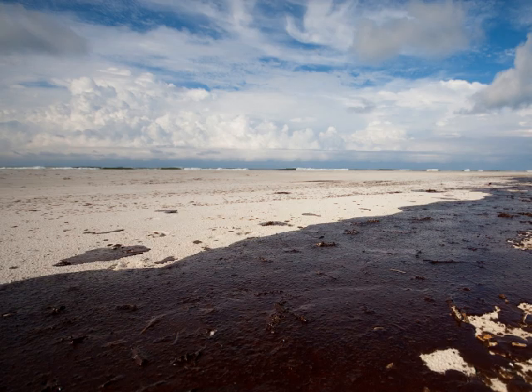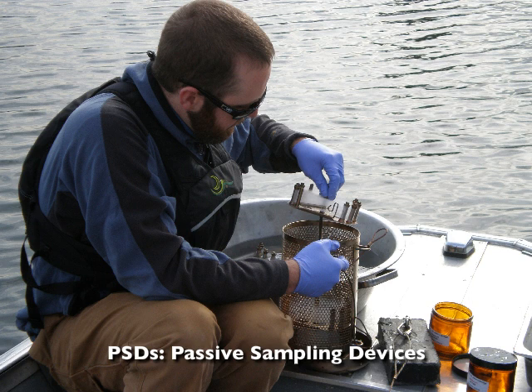This video describes passive sampling devices, or PSDs, a unique tool that we use to measure contaminants in the environment, such as PAHs.